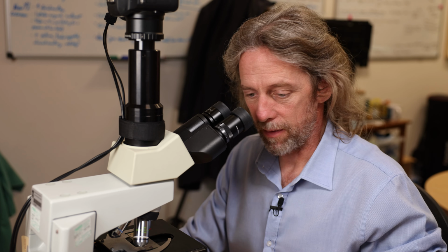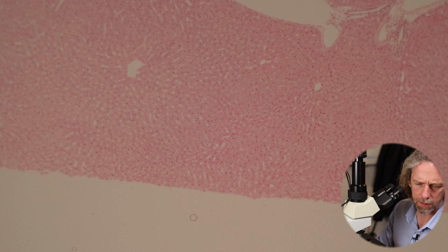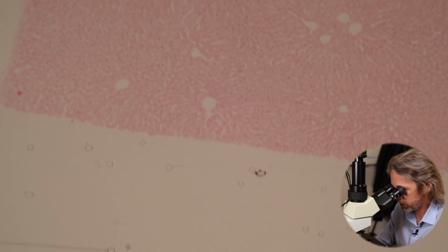Yeah, they're very, very busy cells. They're involved in all sorts. Okay, so let's have a look. Is that in focus? I only struggle to focus for the camera, my low power lens. That looks like it. This is my 4 times objective, and you can see the edges, look, it's just a square of liver from some random spot inside the liver.